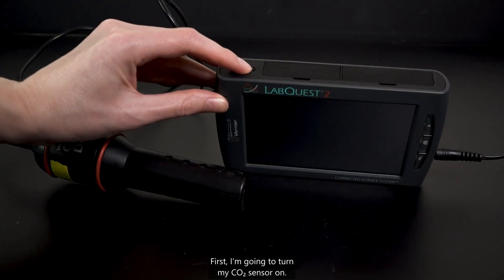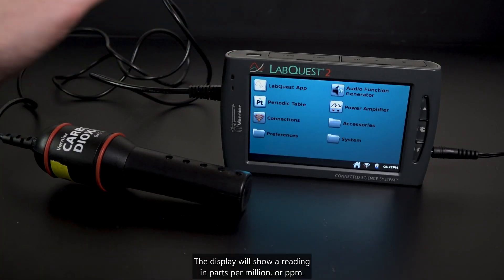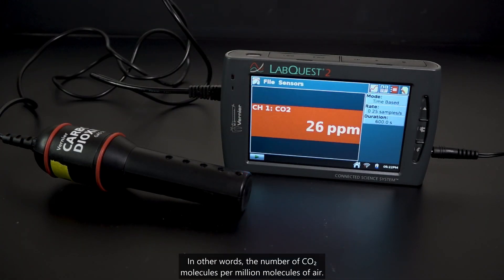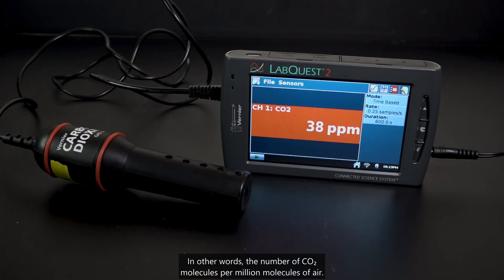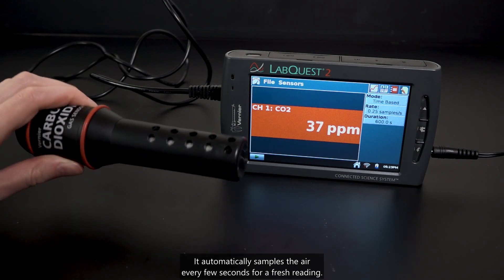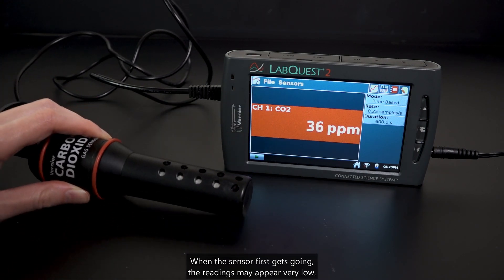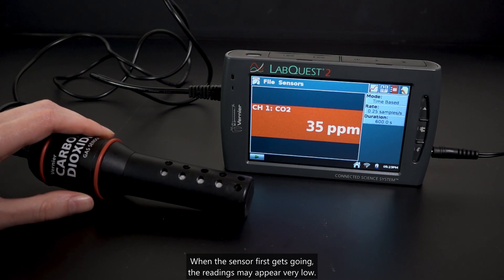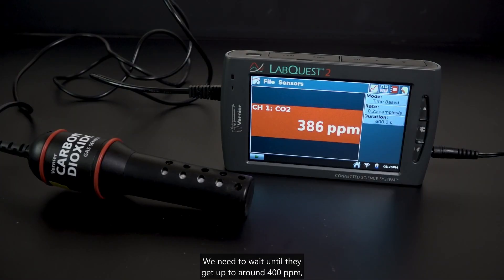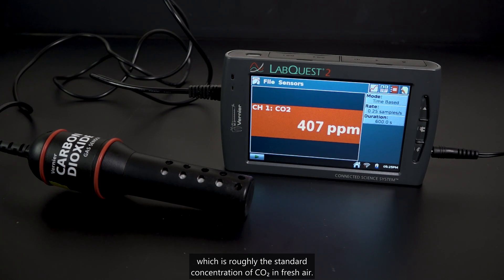First, I'm going to turn my CO2 sensor on. The display will show a reading in parts per million, or ppm — in other words, the number of CO2 molecules per million molecules of air. It automatically samples the air every few seconds for a fresh reading. When the sensor first gets going, the readings may appear very low. We need to wait until they get up to around 400 ppm, which is roughly the standard concentration of CO2 in fresh air.